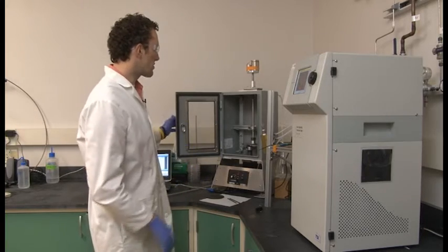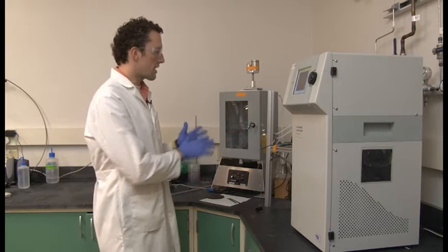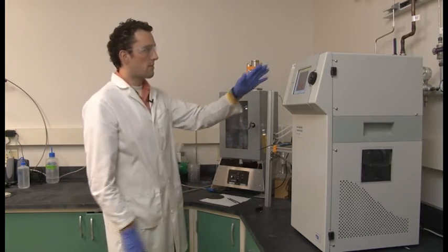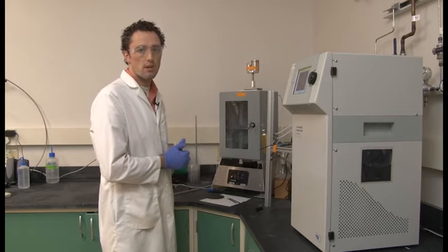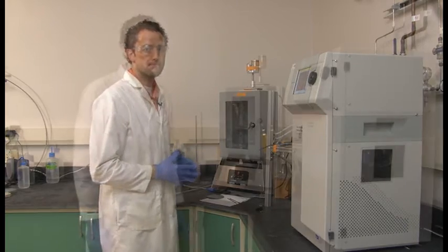So with that, I will close the chamber. We set up the system so that the same amount of air that we're pulling out to all of our instruments is equaled by the amount of air that we're pumping in through a HEPA filter. So we allow the chamber to pump down for 5 or 10 minutes until the condensation particle counter tells us that we're at a good baseline, which is usually between 5 and 10 particle counts per cubic centimeter.